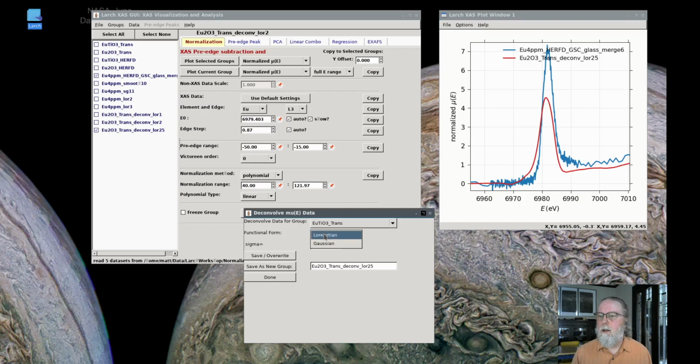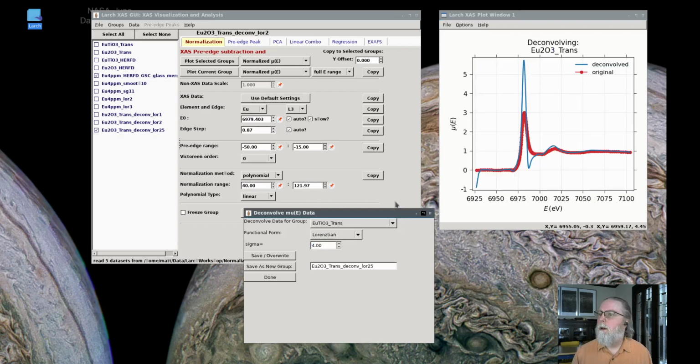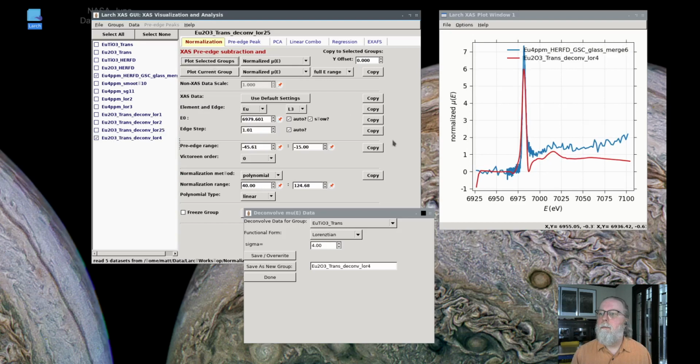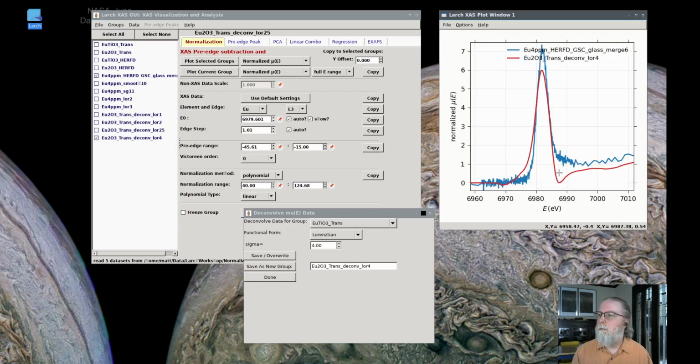In fact, if I make that even bigger, let's go all the way to 4. You can see that the deconvolved data now has a much sharper dip past the edge, which we're going to see is not correct. Plot those two together. This is just to say that now we're reproducing the intensity of the white line, but we've missed something here. I think this shows that while you can smooth and deconvolve data, HERFD is somewhat different than simply deconvolving the transmission or the fluorescence data.